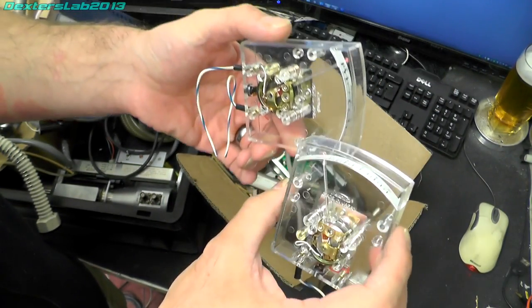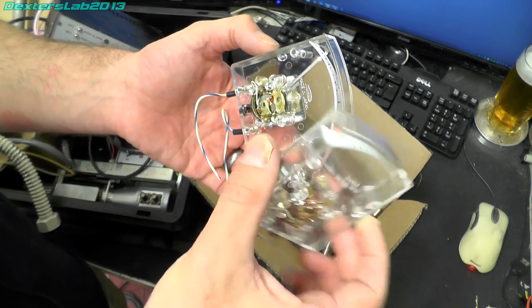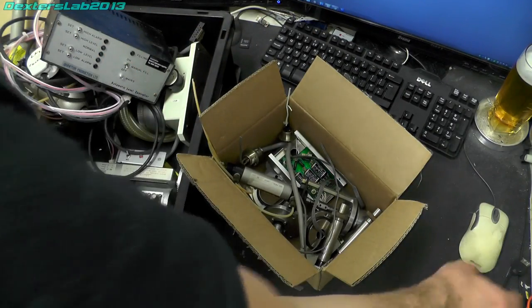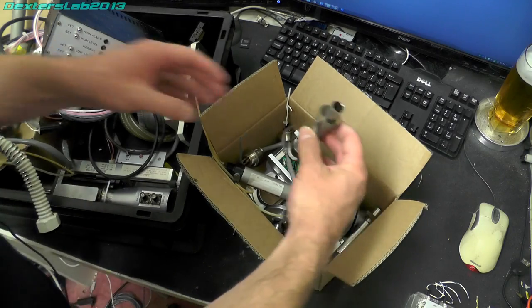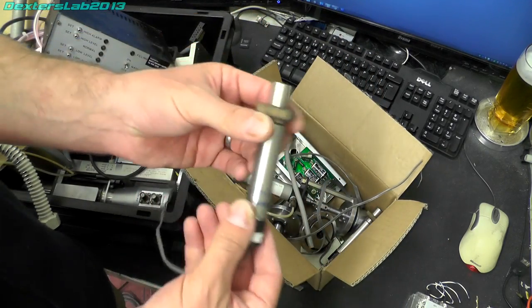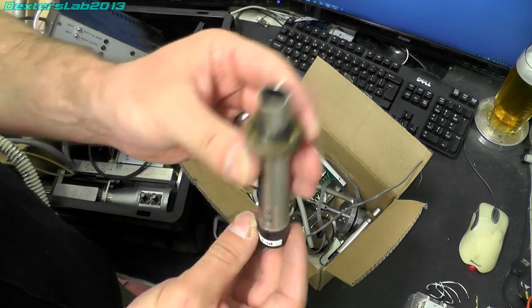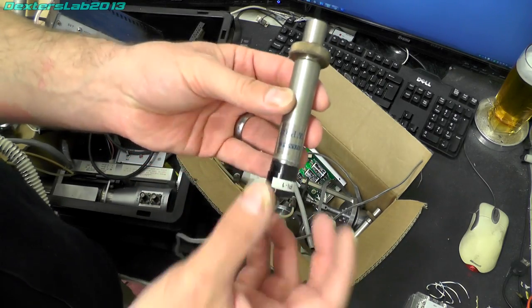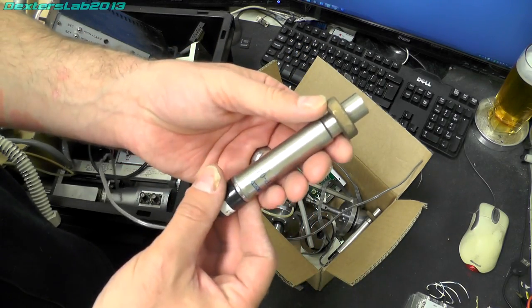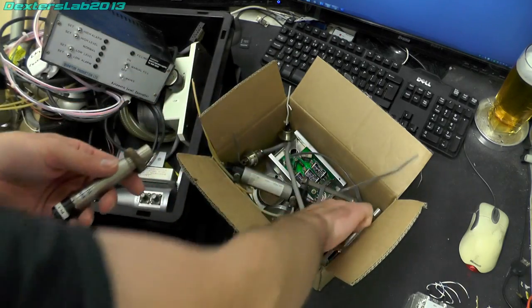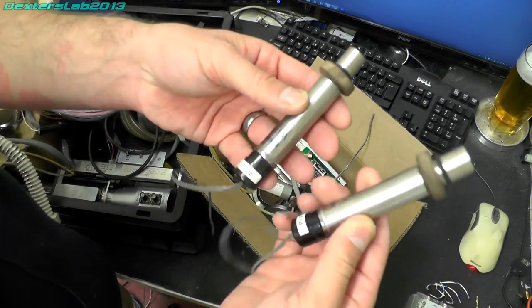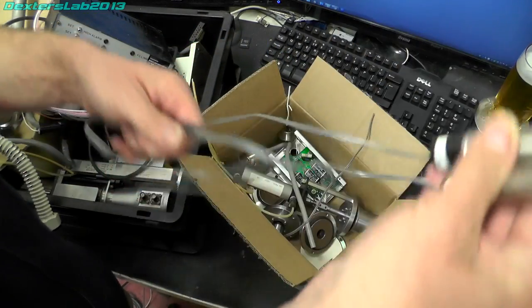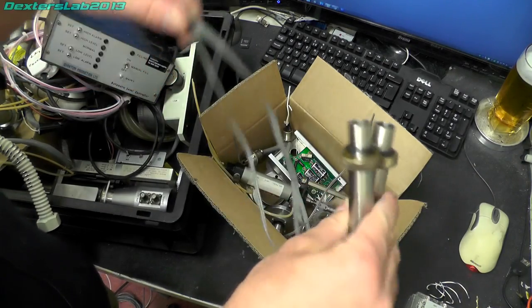That were on the front panel, one of the EEV blog members has asked for those so I've saved those. Also in here we have one of the Pirani gauges, so that's a thermally operated pressure vacuum gauge. I think there's two of those, so if anybody needs those let me know because I just saved those anyway.